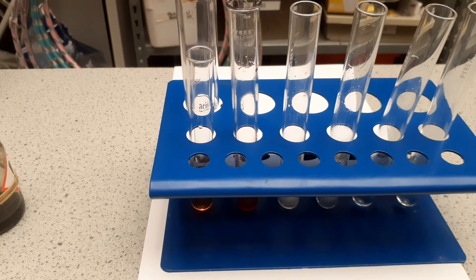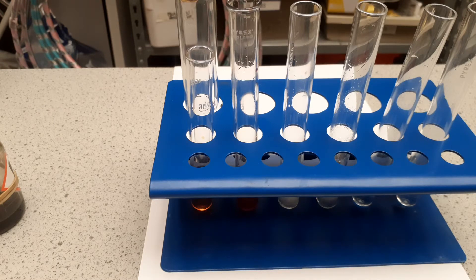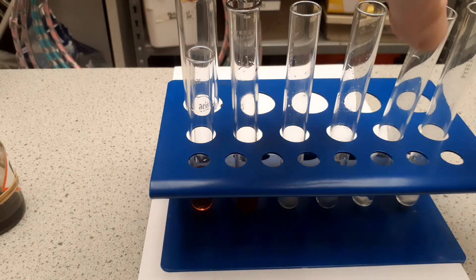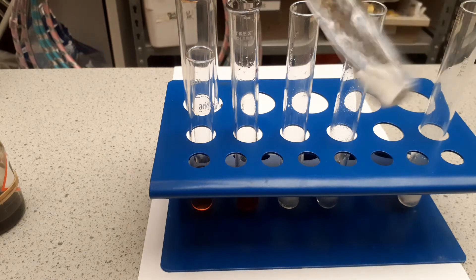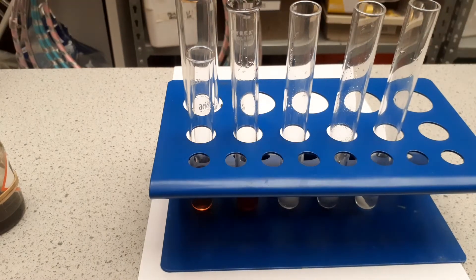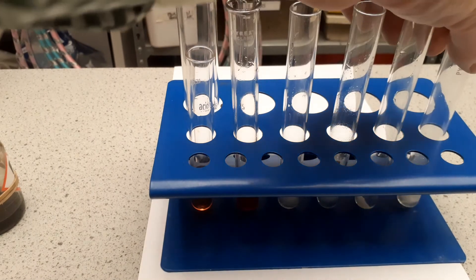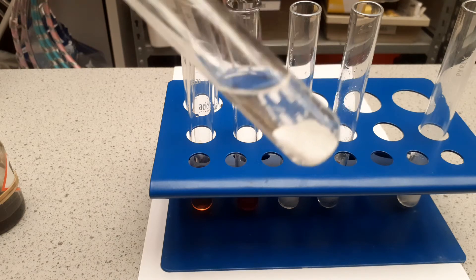The third reaction is with marble chips — I'm going to put a marble chip, which is calcium carbonate, in each. The ethanoic acid is bubbling very slowly, and the bubbles produced are carbon dioxide. Looking at the hydrochloric acid, the reaction is much faster — production of carbon dioxide is much faster. Looking back at the ethanoic acid, it's still bubbling very slowly. So it's a much weaker acid.